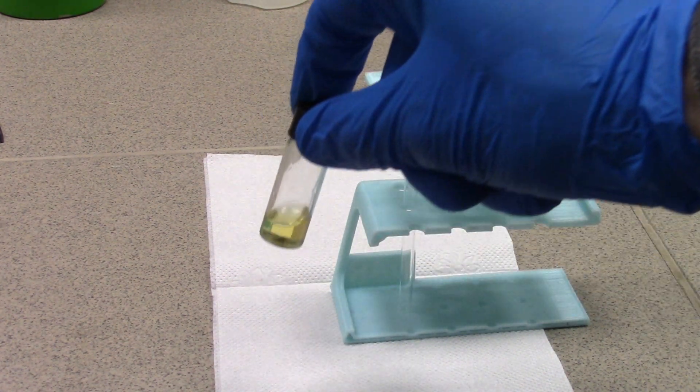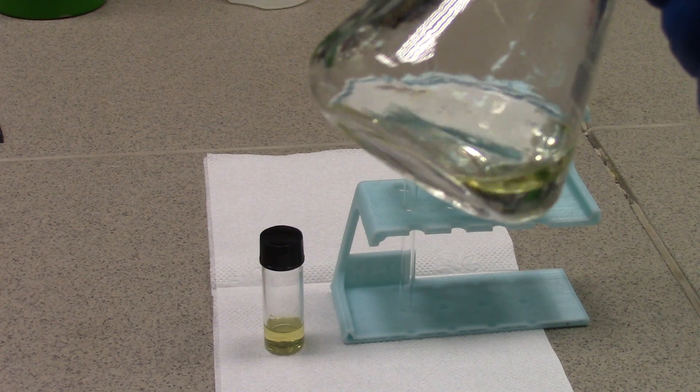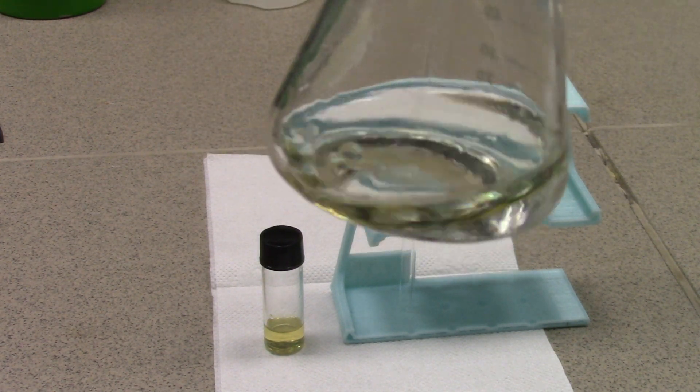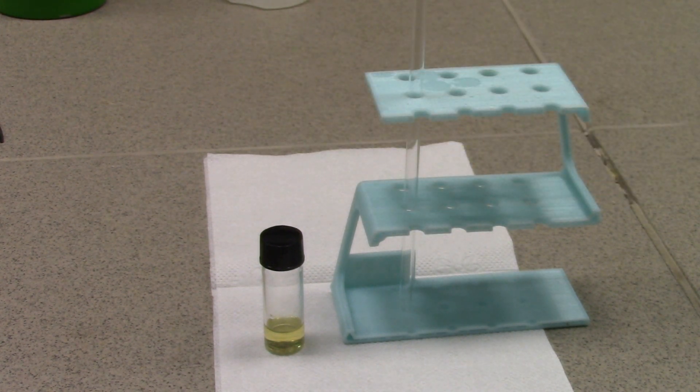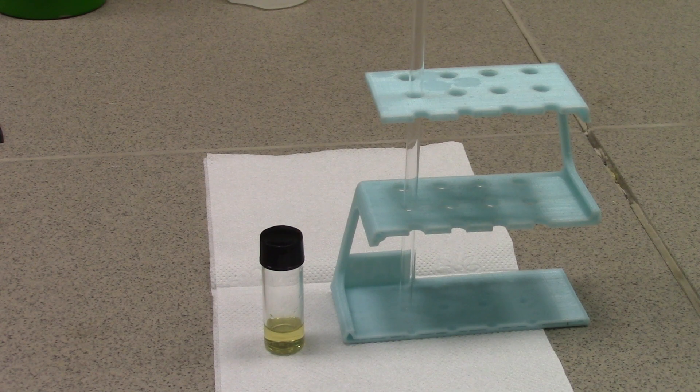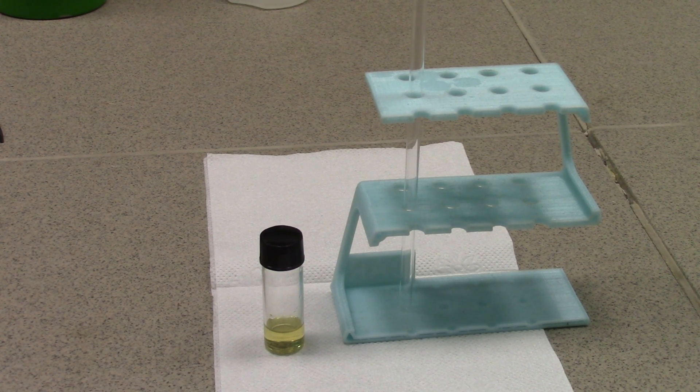To sum up, I have made about 1 gram of pretty pure DBD and additional 2.7 grams of less clean product from the top layer, which corresponds to 57% yield. Don't worry, it would be higher, about 80%, but as you know, less loadings leads to greater loss.